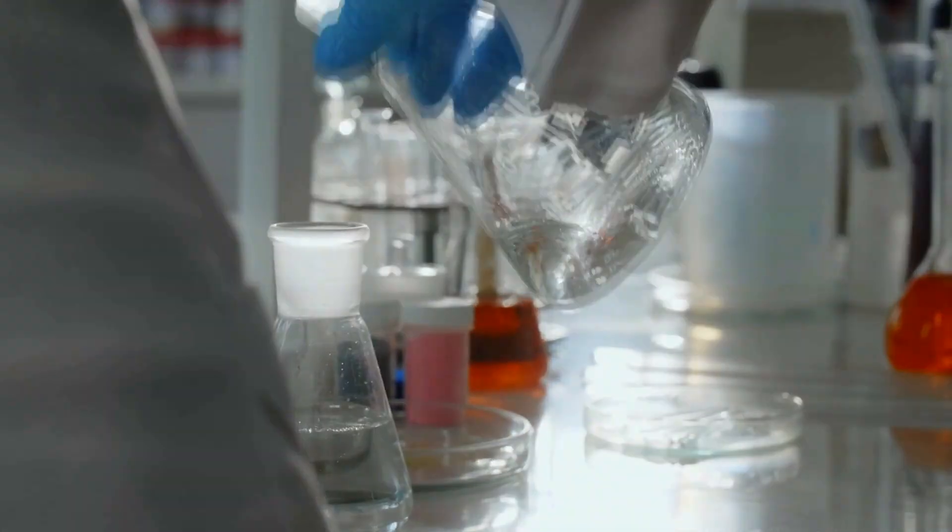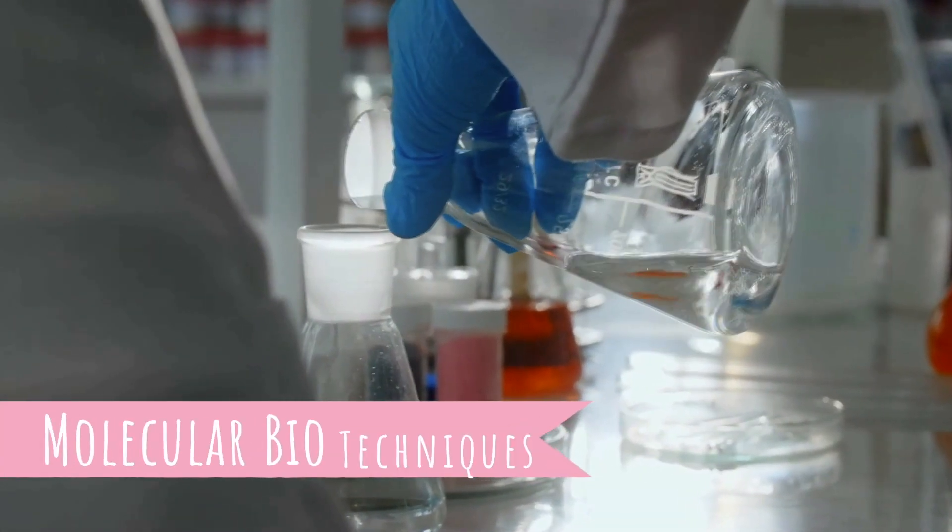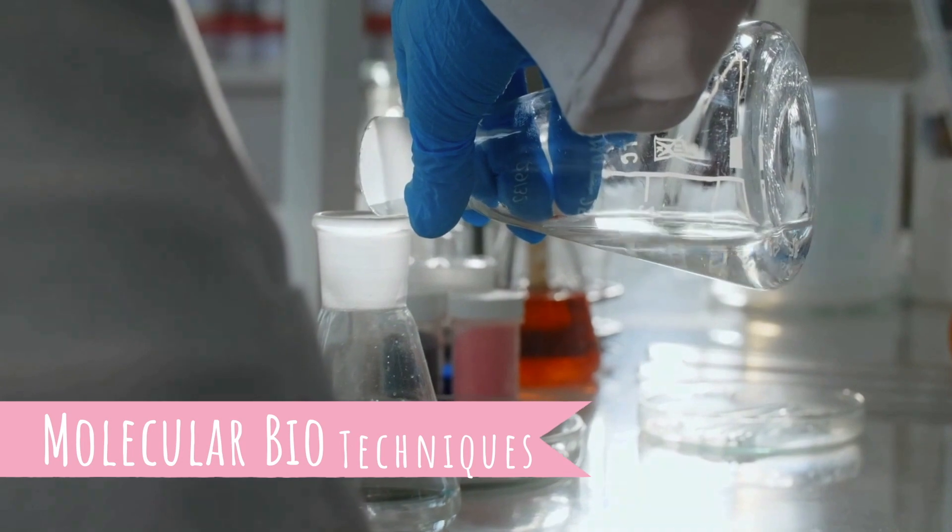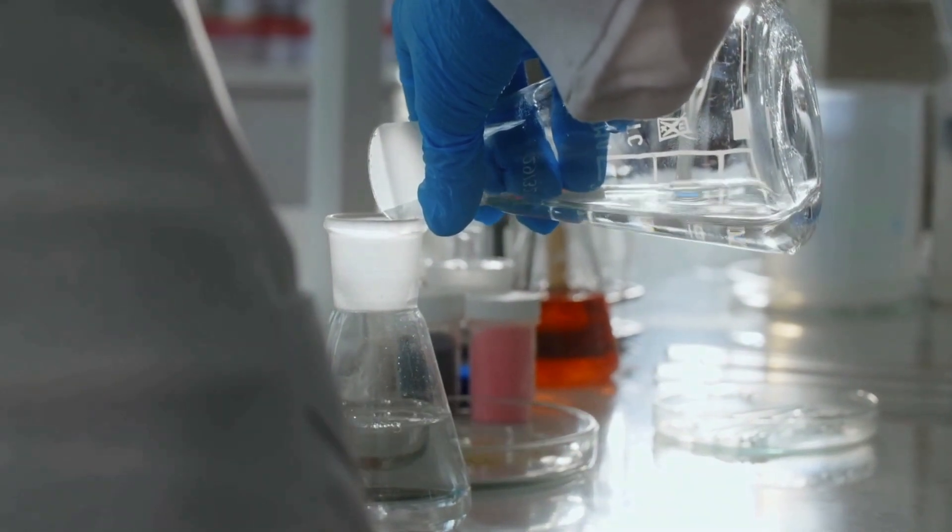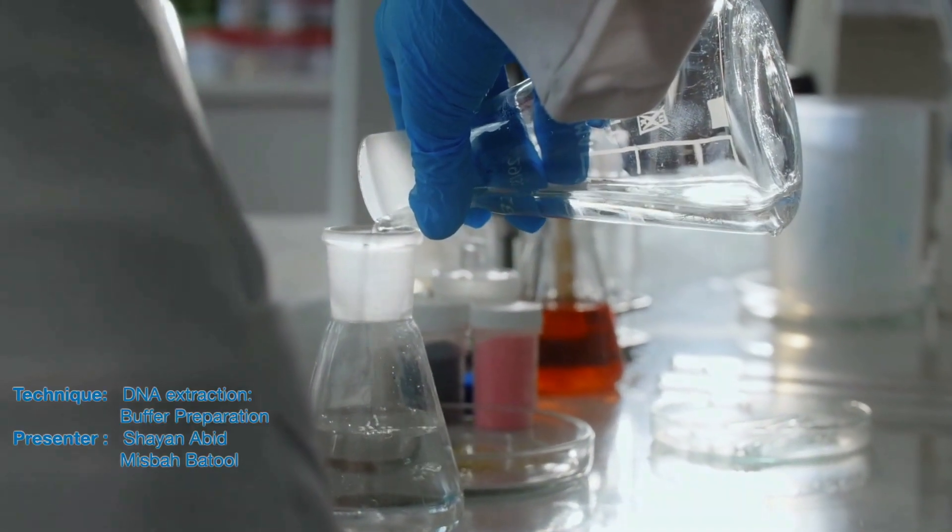As-salamu alaykum everyone. Hope you are enjoying our new series on molecular biology techniques. Today I'm going to demonstrate the complete scheme of DNA extraction protocol.